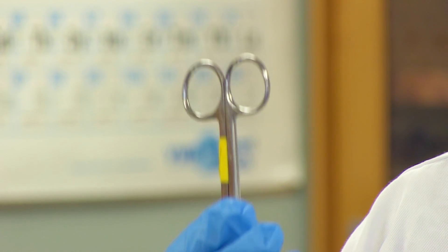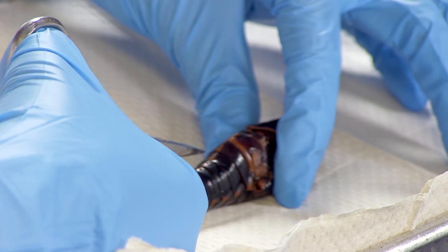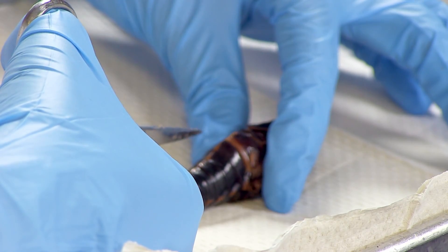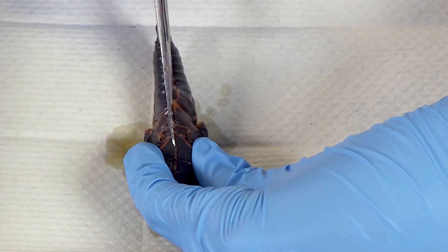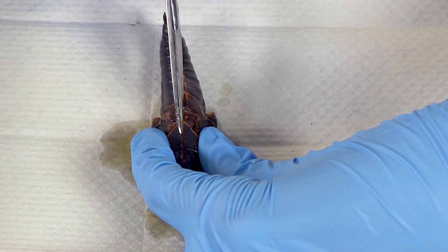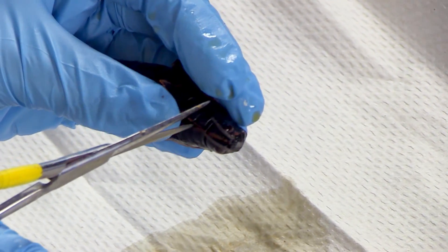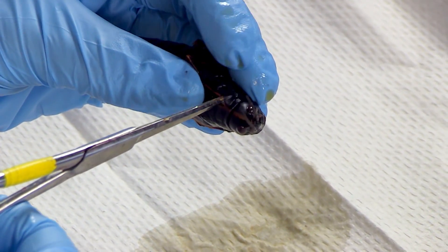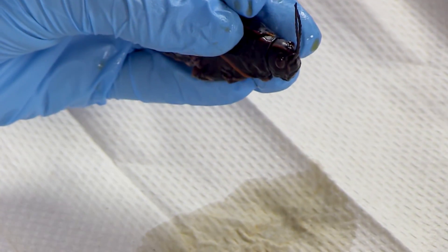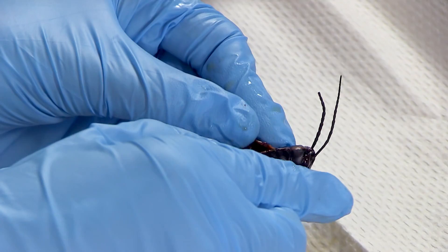Begin the dissection by using scissors to cut up the dorsal side of the exoskeleton. Do this from the tip of the abdomen all the way to the head. Make sure your cuts are shallow so as not to cut into internal organs. Hold the scissors parallel to the dissecting pan to cut. Hold the exoskeleton up and cut just underneath it with the point of the scissors. Gently remove the dorsal wall of the exoskeleton.